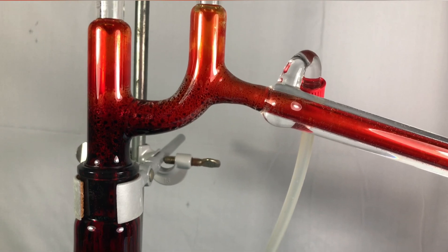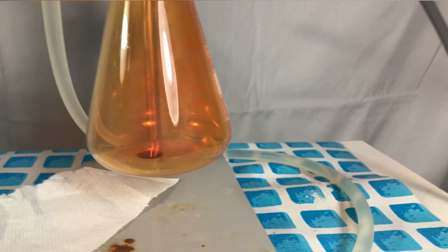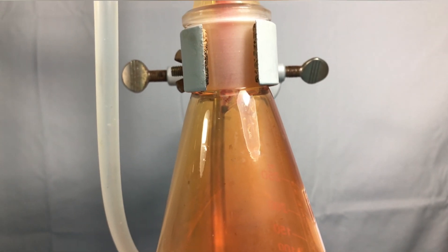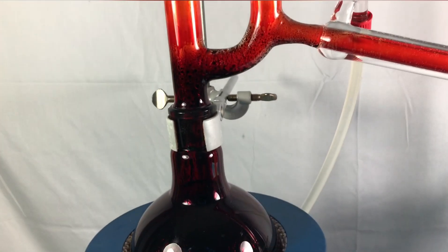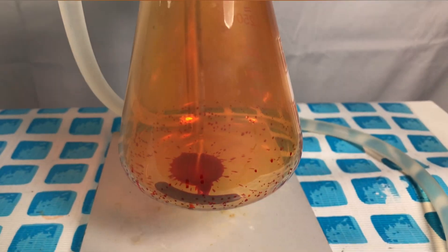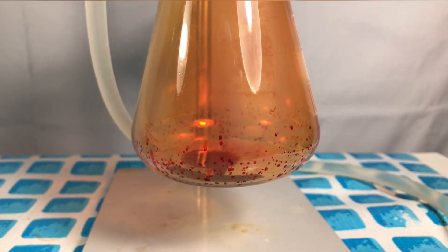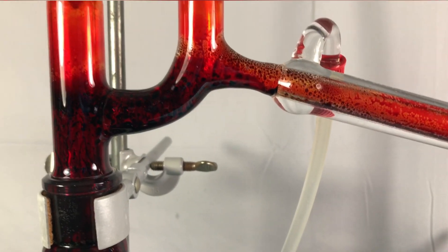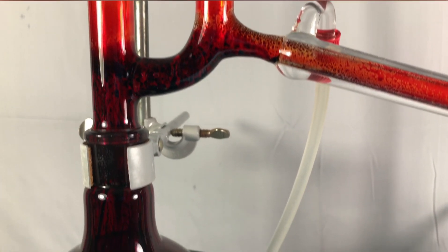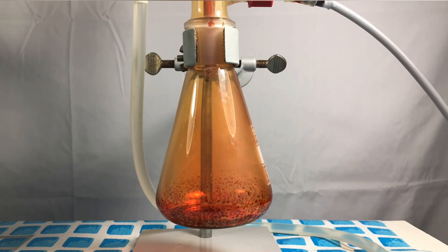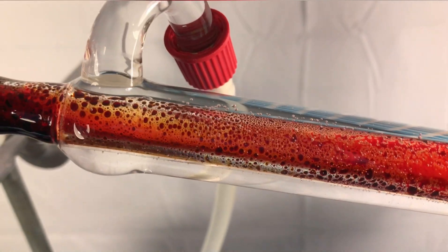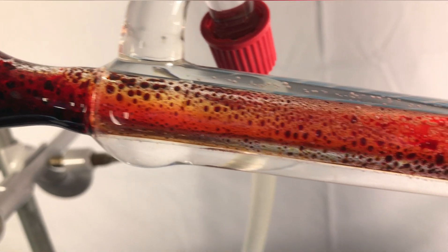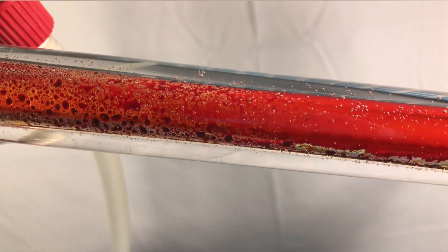After only a few minutes of waiting first chromyl chloride started distilling over. If we were distilling bromine the vapors would look a lot cleaner and clearer. The moment I saw the first drop of chromyl chloride I was really happy. In real life it actually looked like blood. If your blood however starts fuming like chromyl chloride you should probably go and see a doctor. The condensing chromyl chloride looked really beautiful. You can see those small drops condensing on the Liebig condenser, flowing downwards and then quickly forming larger and larger drops which are ending up in the receiving flask.